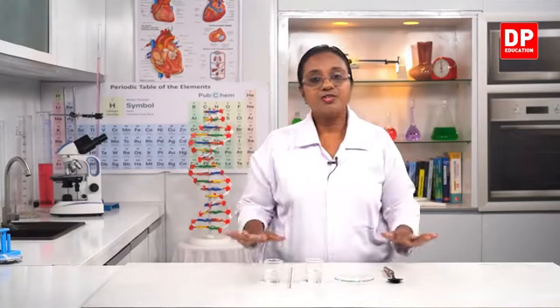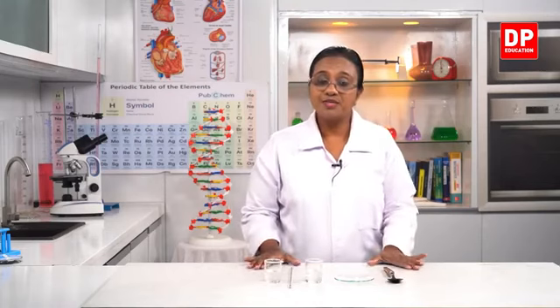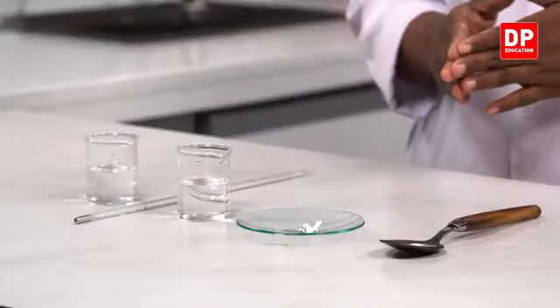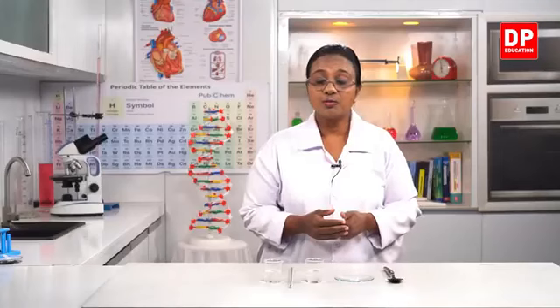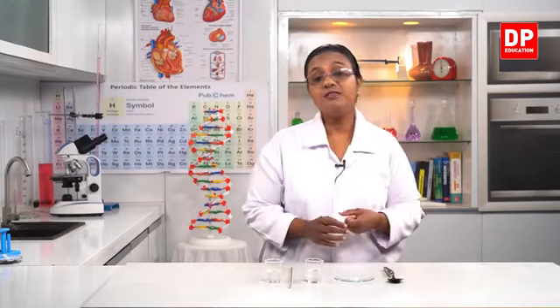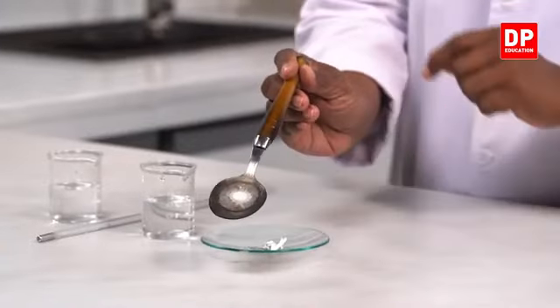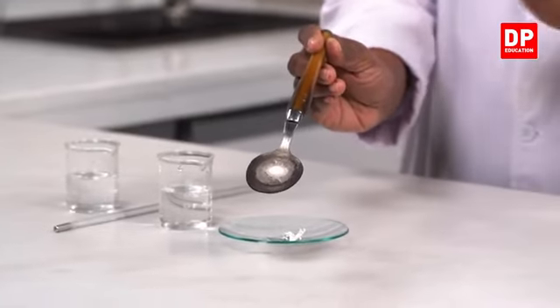Okay, students. So, I showed you all 4 different parts of the activity and here I have all the final observations that we got from the activities. So, you can remember first we took the naphthalene balls and that was the solid. When I put it into this hot spoon, you saw the naphthalene becoming a liquid. So, there was a physical change from solid to liquid. Then I showed you all also, you saw the solidifying process, the liquid becoming solid, but now here you can see it has completely become a solid. So, from the solid we got the liquid, again from the liquid we have got the solid.